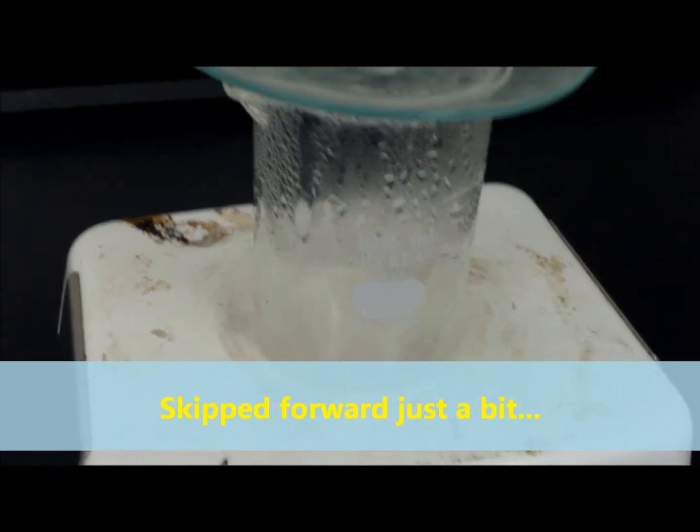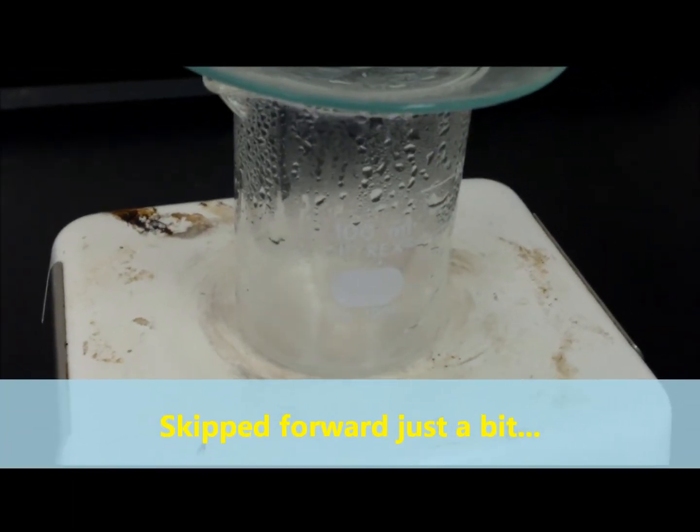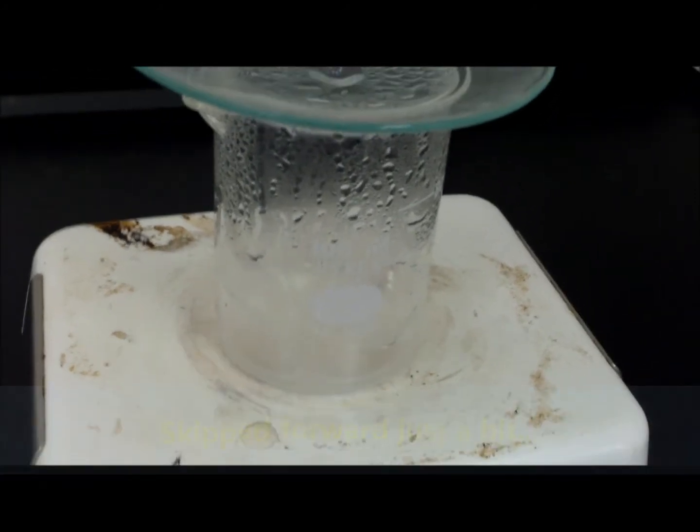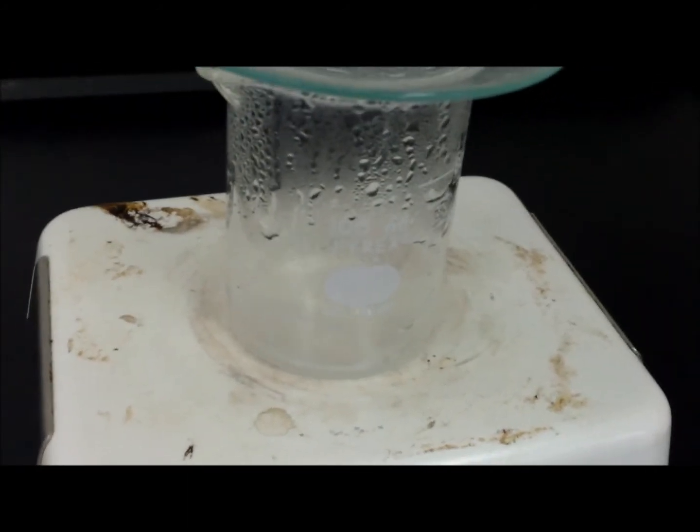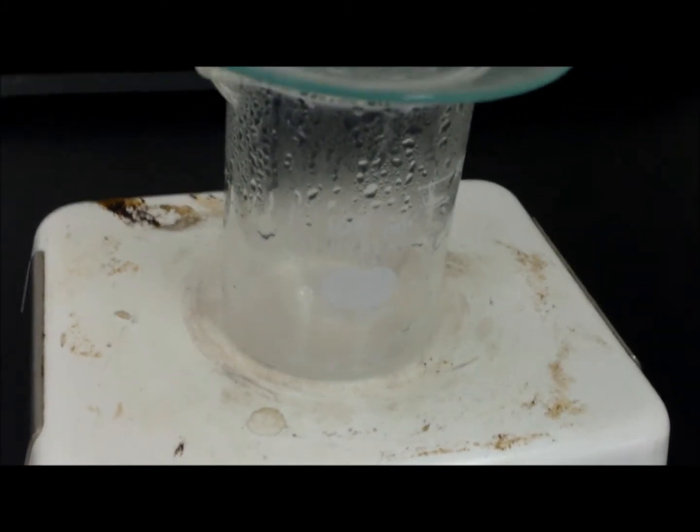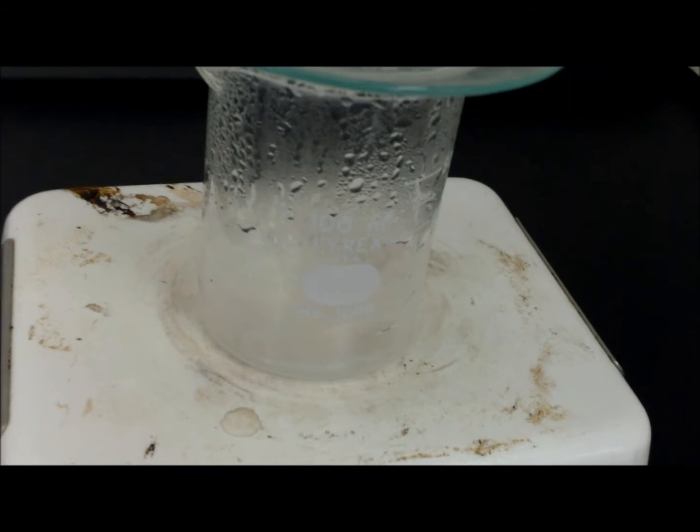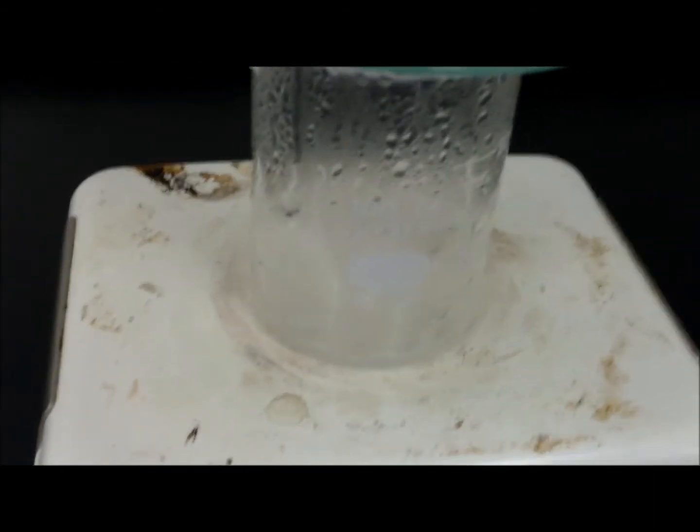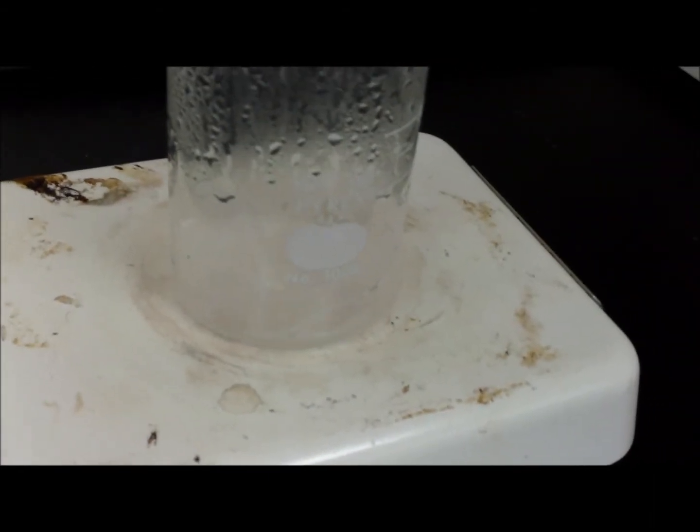Okay, so we're getting really close now. The amount of liquid that's left in the beaker is very, very small. We're starting to see kind of a more whitish color and we're seeing that the bubbles are more viscous looking, and real soon we're going to start to see evidence of that salt.